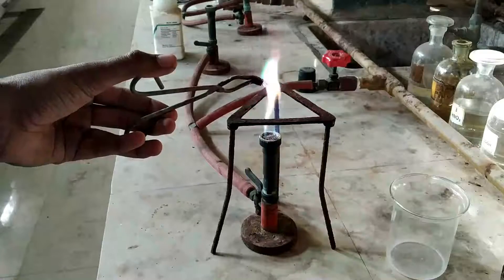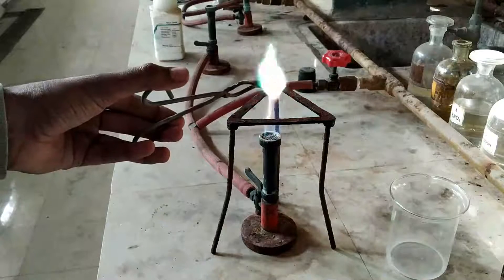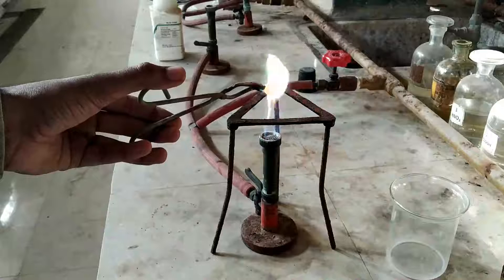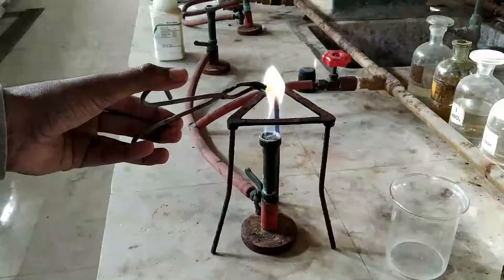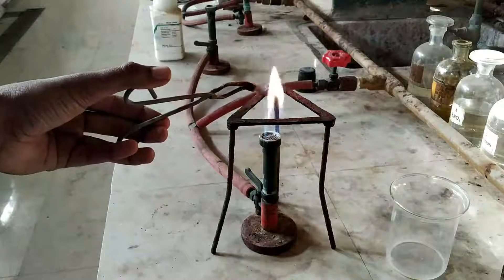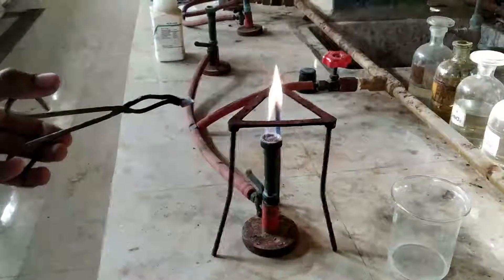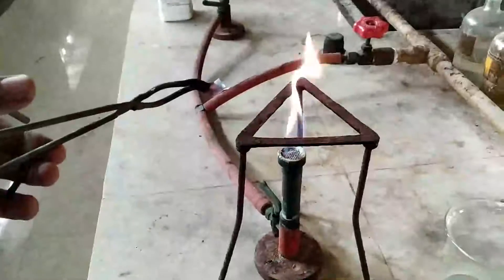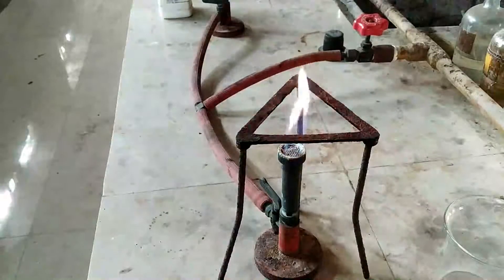Just observe the color of the flame — you will see a green color flame, which suggests the presence of a halogen element, may it be chlorine, bromine, or iodine. Once again, have a close look at the test and the color of the flame.